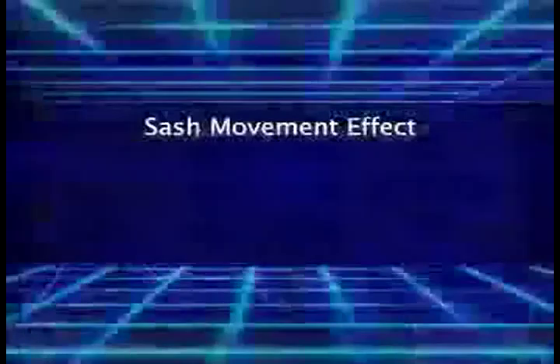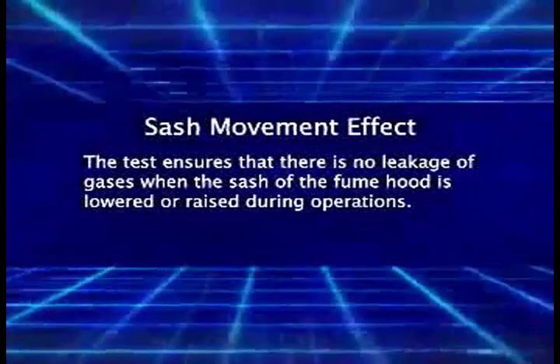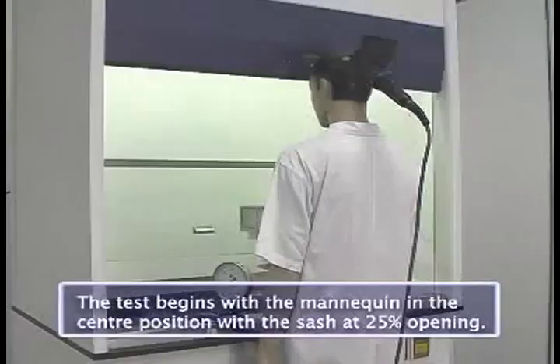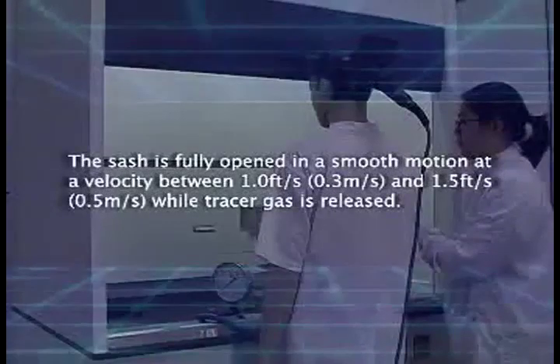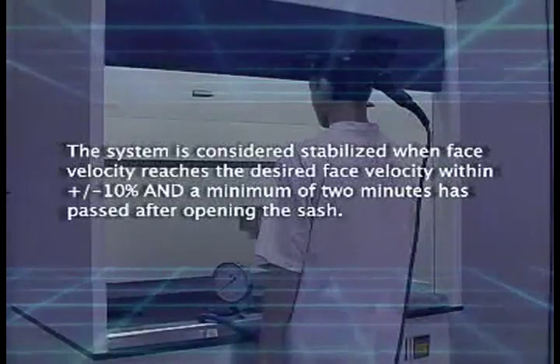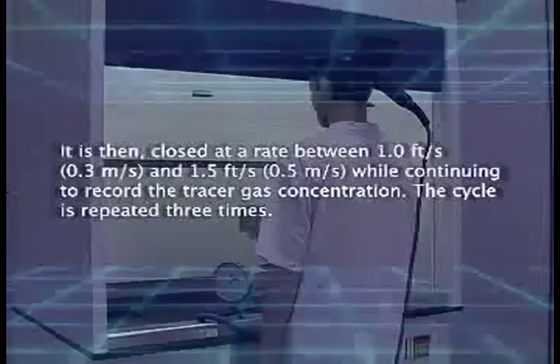The sash movement effect test ensures that no gases leak from the hood when the sash is raised or lowered during operation. A mannequin with sensing equipment is placed in the center of the hood with the sash height at 25%. In one smooth motion, the sash is fully opened while SF6 tracer gas is released within the work zone. Once face velocities reach the desired levels and two minutes have passed since the sash was opened, it is closed again. The sequence is repeated three times.